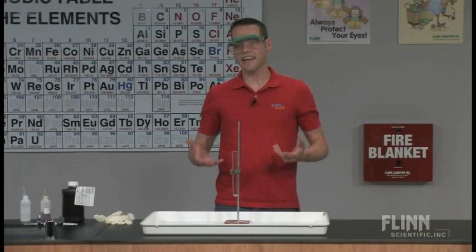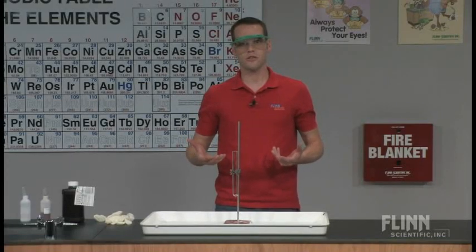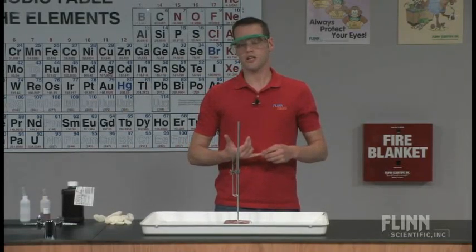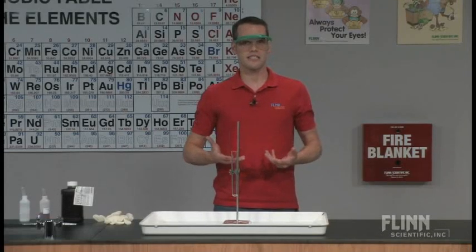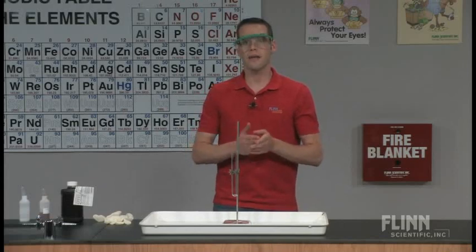There's a really dramatic and spectacular example of catalysis that you can do that involves the decomposition of hydrogen peroxide. In this case, we're going to be using iron-3 ions to cause the decomposition of the hydrogen peroxide.